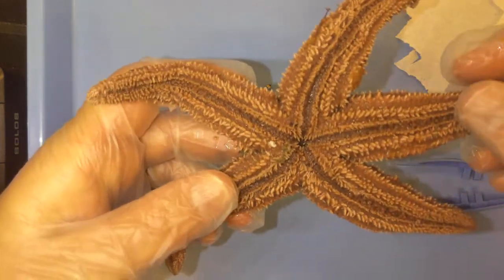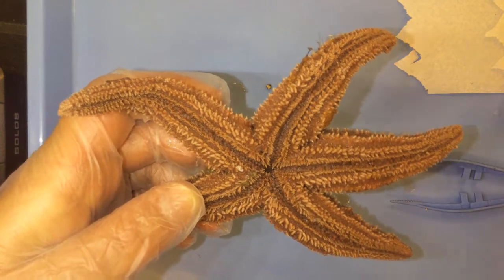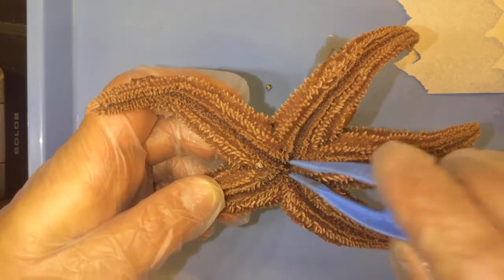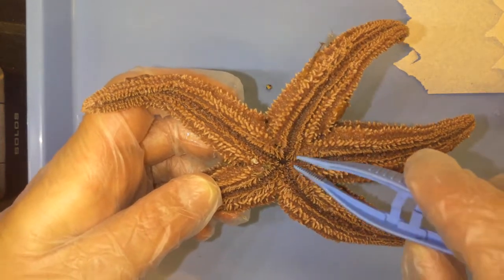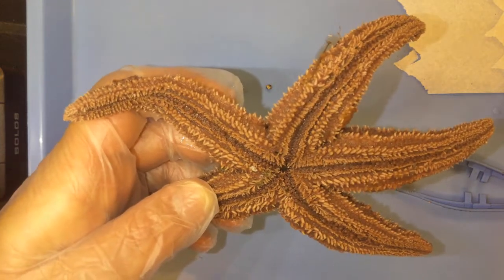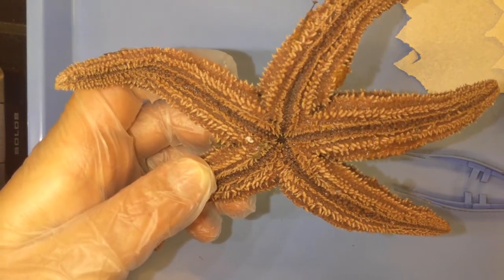Let's go ahead and flip it over. We're going to see now the ventral side of the sea star. This is known as the oral side because this is where its mouth opening is located in the central disk area. The way that the sea star feeds is that it will stick its stomach out of its mouth, and this stomach is covered in digestive juices and enzymes, which help to break down and dissolve the food or prey that it was able to capture.